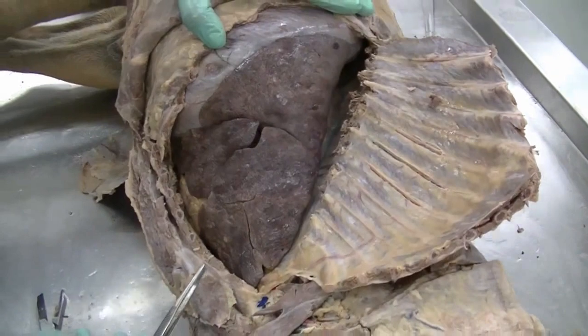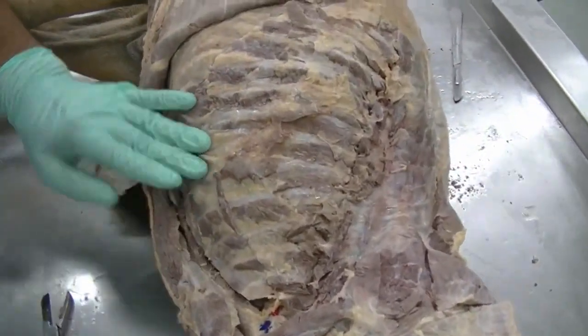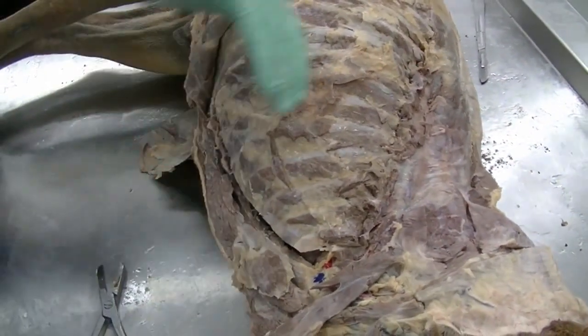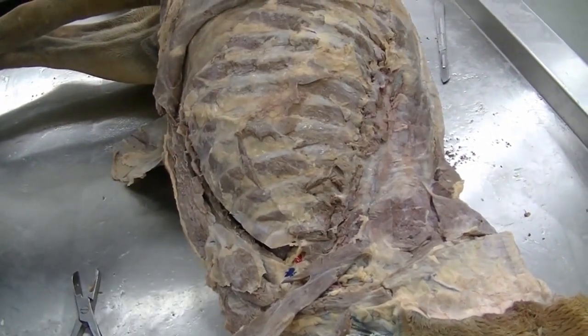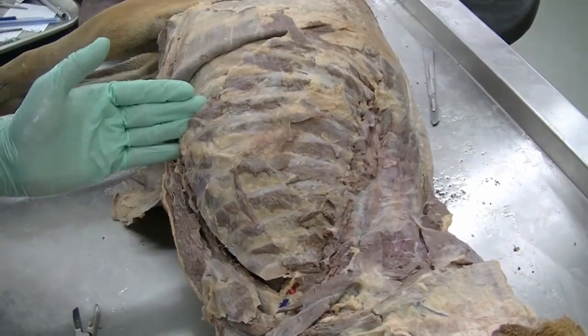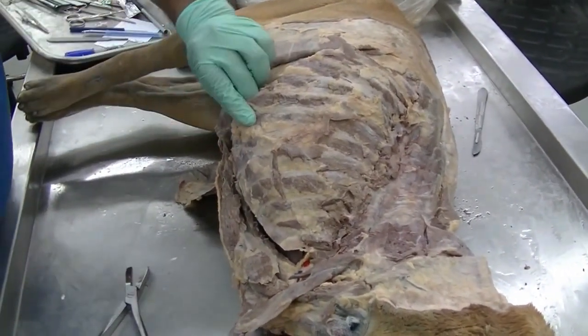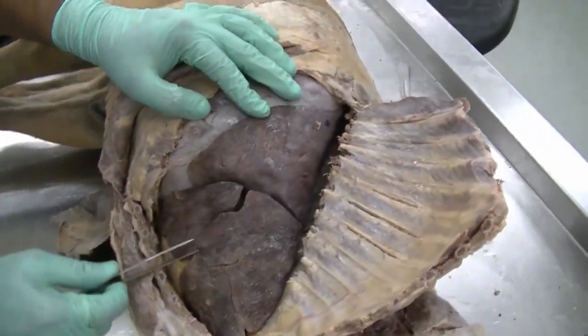We have now opened the right thoracic cavity. We followed the same way to open the thoracic cavity on the right side, cutting along the costal cartilages on the ventral aspect, breaking the ribs before we reflect the wall, and cutting along the costal arch. The same thing we did on the left, we cut the costal arches and costal cartilages here as well. Flipping the wall, we can now see the right lung.